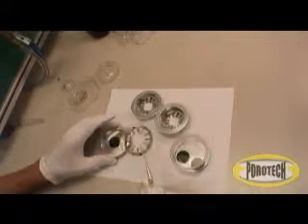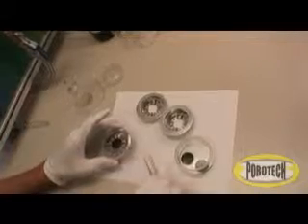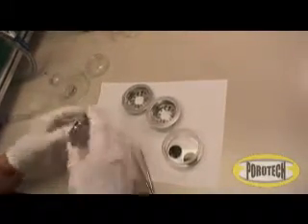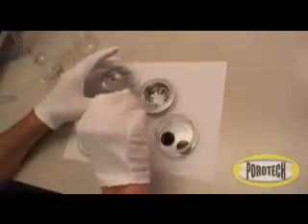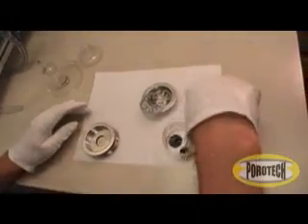It is then secured via a flat spring, which also serves to separate the holding cups and prevent contact between the test sample and the two reference standards during the weighing step in the testing process. The process is repeated for the actual test sample and the second standard.